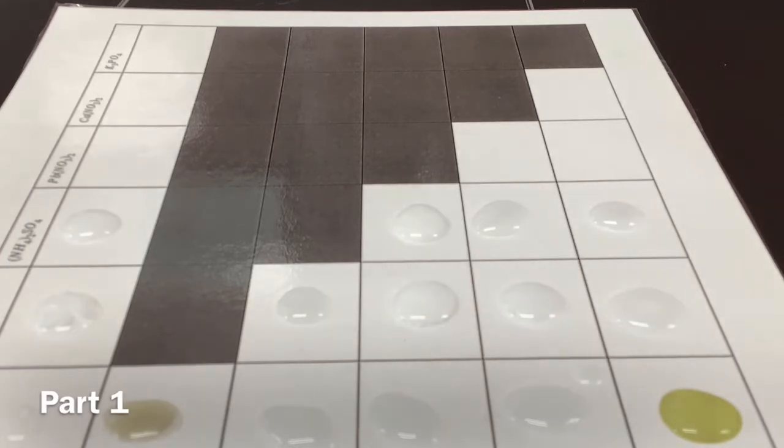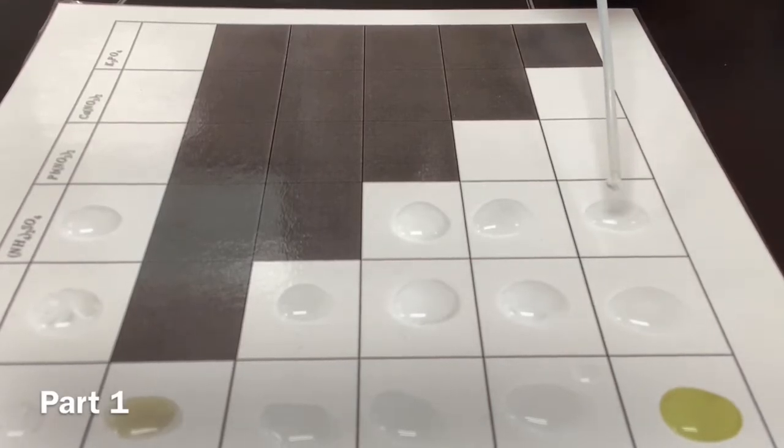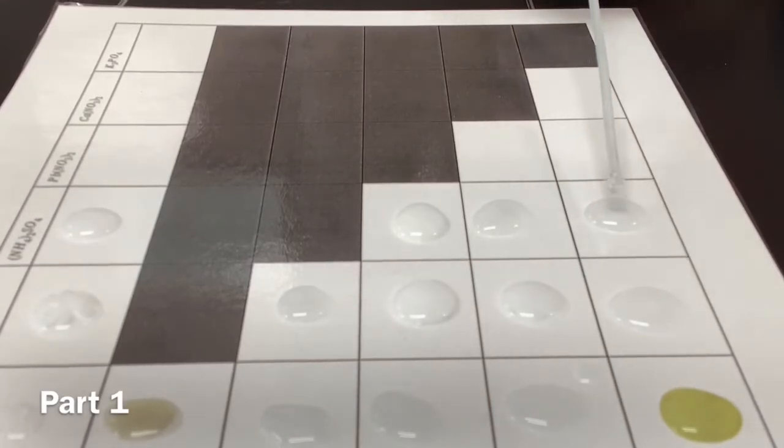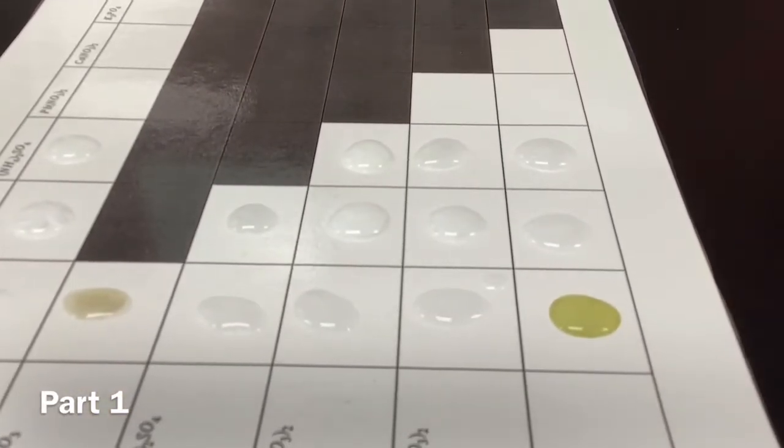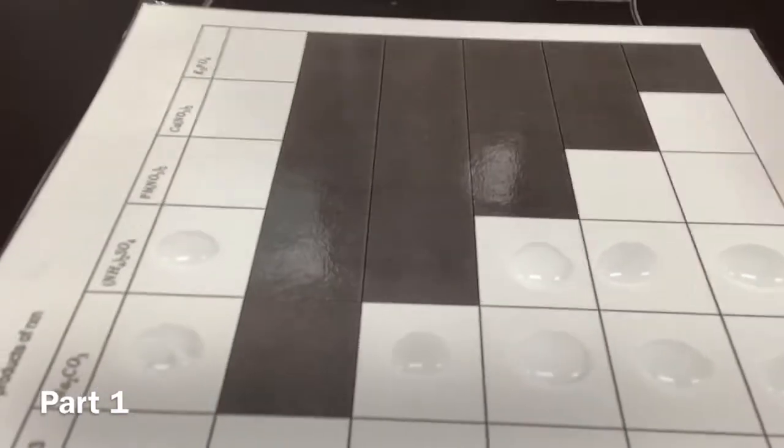Good. Okay, and then we got our potassium, which is a K, and it's yellow because of bananas. Don't let that deceive you. This potassium is actually clear. Yes, that is true. It looks disappointing, but true. Very disappointing. But look, this one is yellow. Proof potassium makes bananas yellow. Oh, and if we go back to this one, the precipitant in this one is starting to settle. Oh yeah, that's true. Great question. I don't know exactly.